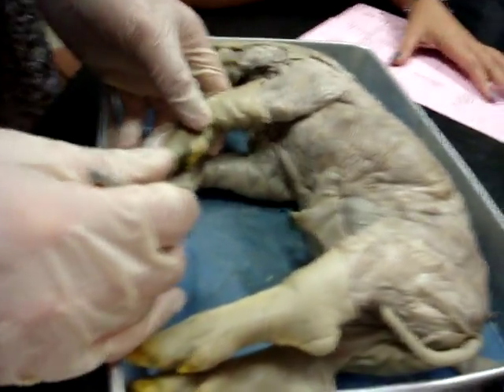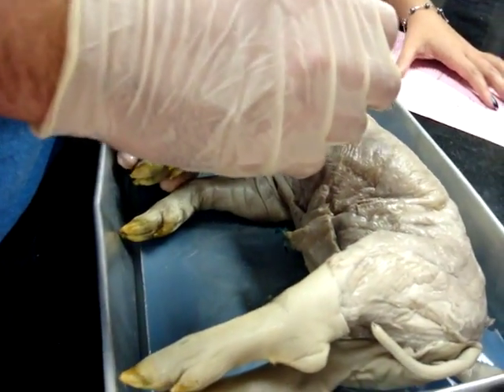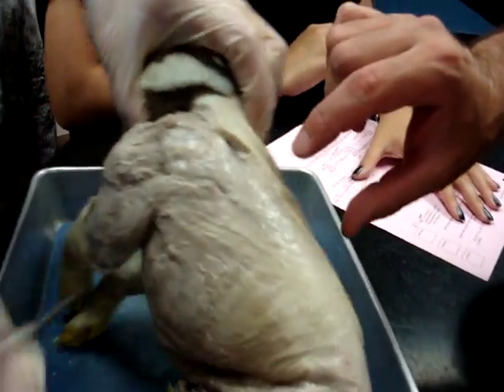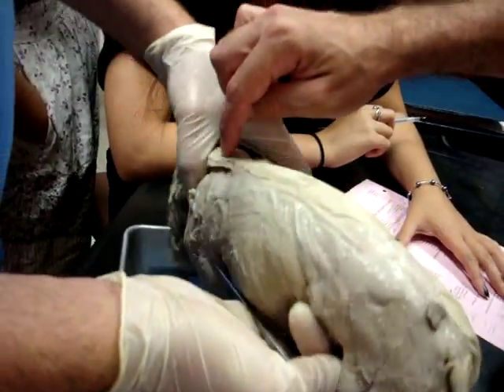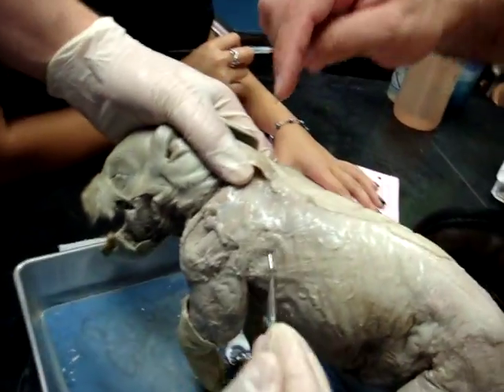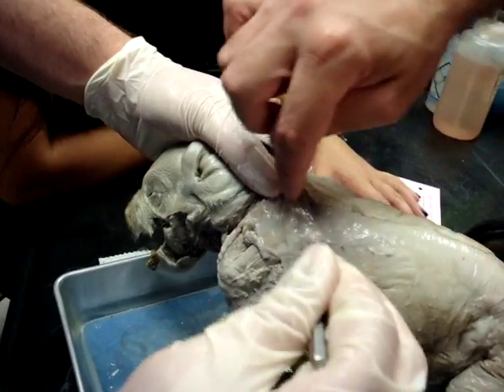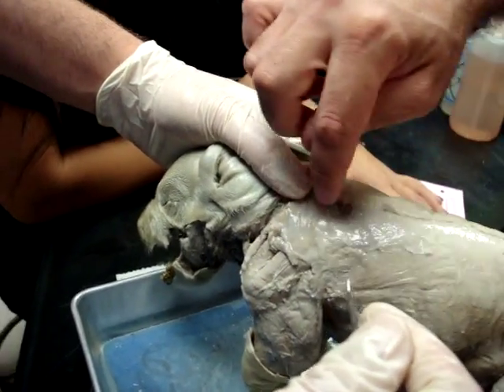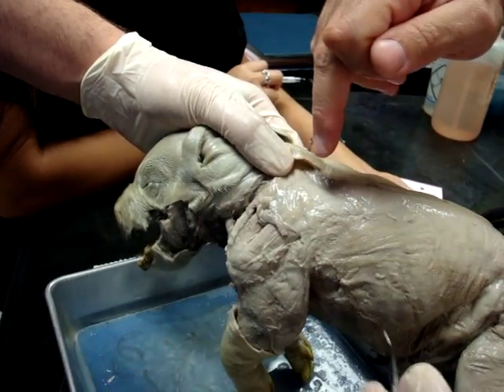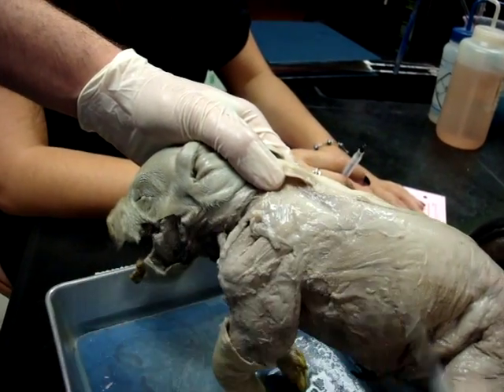How about the trapezius? The trapezius is on the top. What happens is the trap is basically going this way — down, this way — and then the other one goes up this way. So here's one, and here's your trapezius going this way. You can kind of see the fibers coming down off it a little bit — it's underneath there. So your traps go this way. See how you just cut into that smooth part right there? That line? That would be where your traps are going.